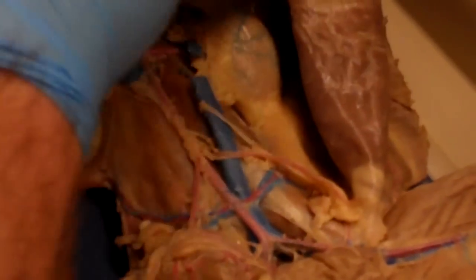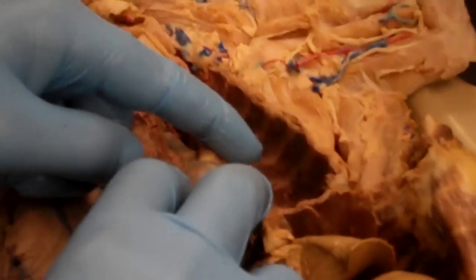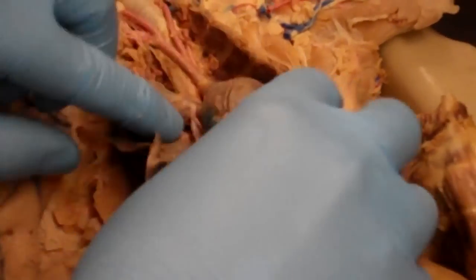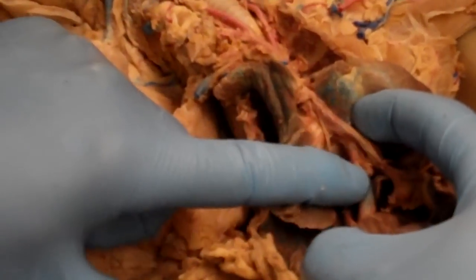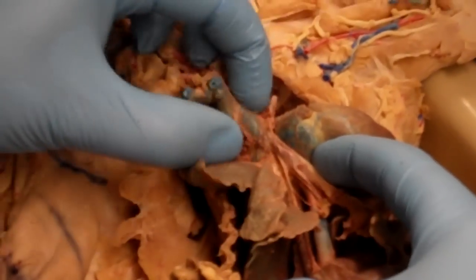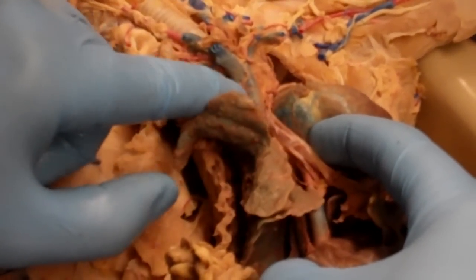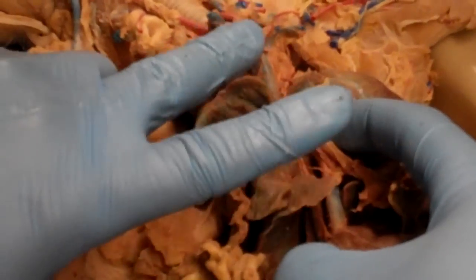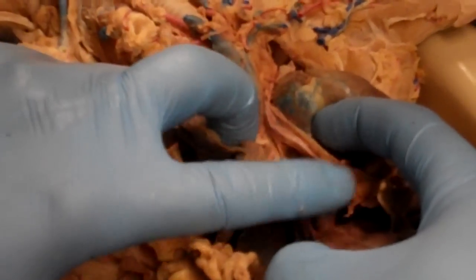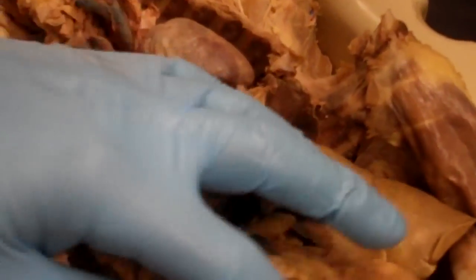Yeah, so if we go to the heart, this guy doesn't have the best injected veins, but this is going to be the aorta, which is the main blood flow coming out. The main blood flow going in is going to be the inferior vena cava right there, and the superior vena cava, which is right there. Oh, okay. So we have two big veins converging on the heart, superior vena cava and inferior vena cava. One artery coming out, which is going to be the aorta.